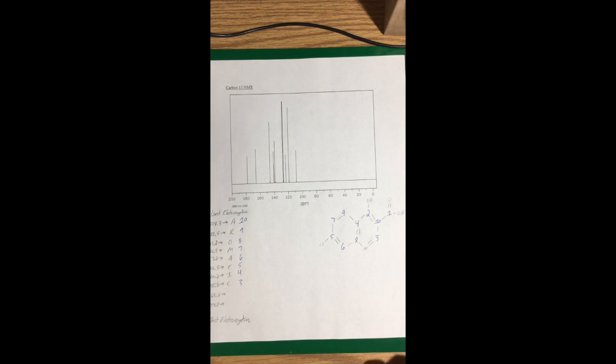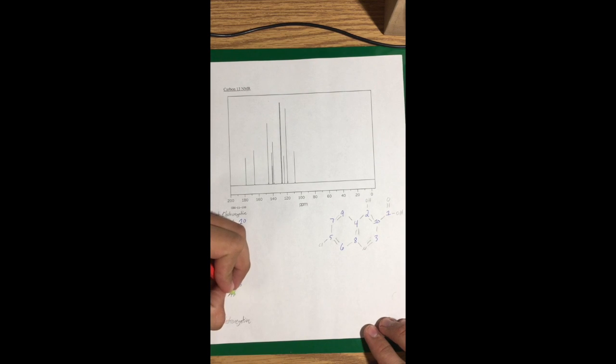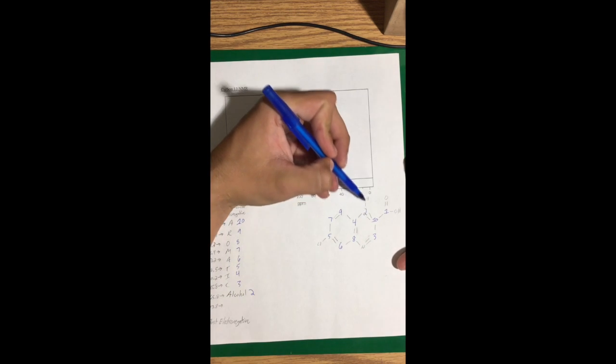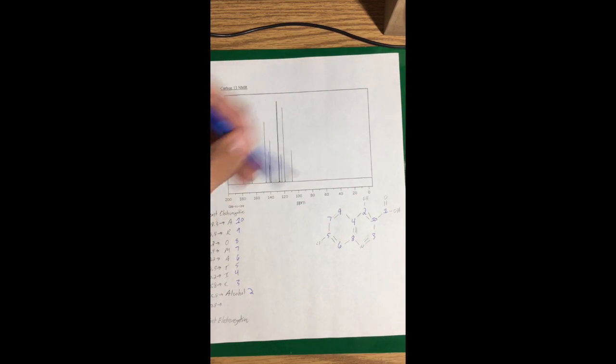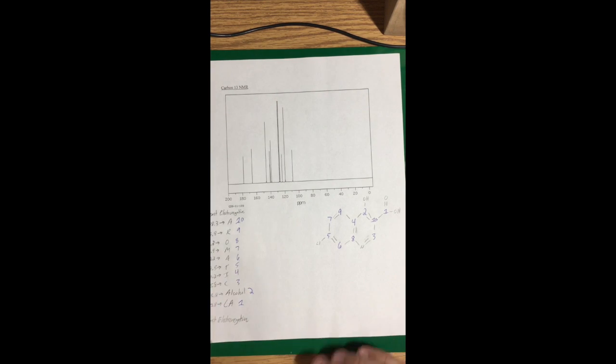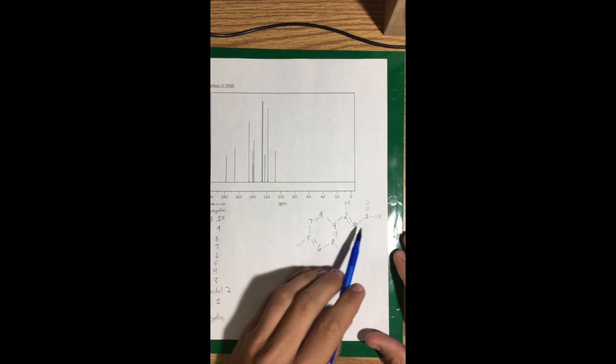At 165.8, this is going to be an alcohol. Label it 2, and you can see up here in this corner, it's at the alcohol, and it's pretty close to the carboxylic acid, which comes in at 177.8. Label that with CA. And this is going to be 1 because it is attached to the most electronegative part of the atom, which you can see is right here.